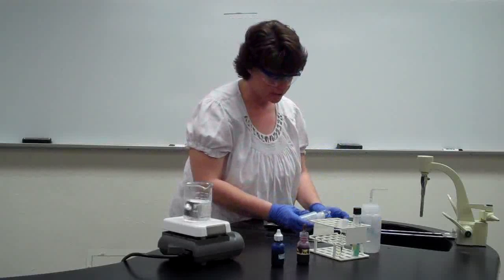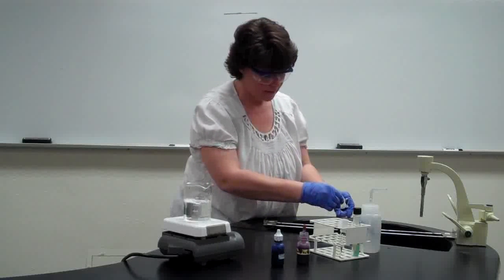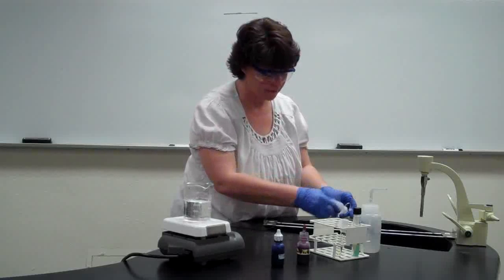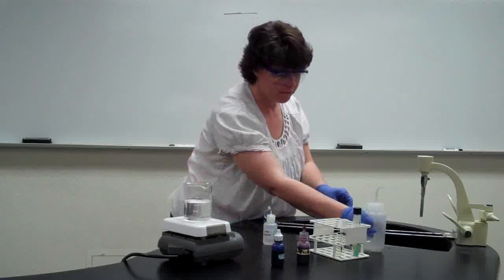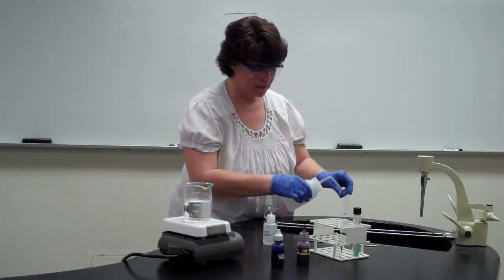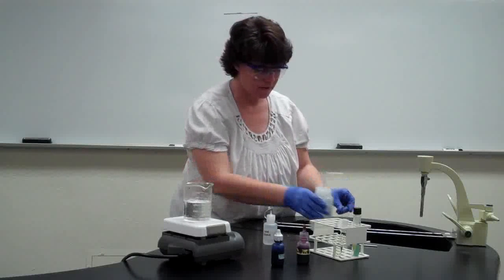And so we're going to do just like we did with the gram stain. We're going to just drip on there until the stain runs almost clear. Not clear, but where it's a very light pink. Okay, just as we did before, we want to stop that process right away. So we're going to rinse it immediately. And once again, we're not drying between any steps.